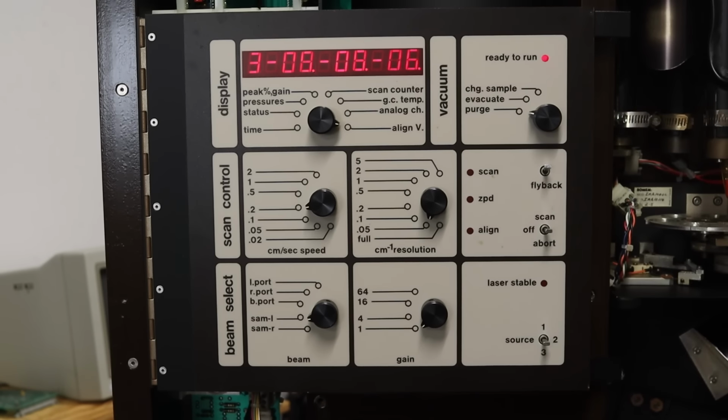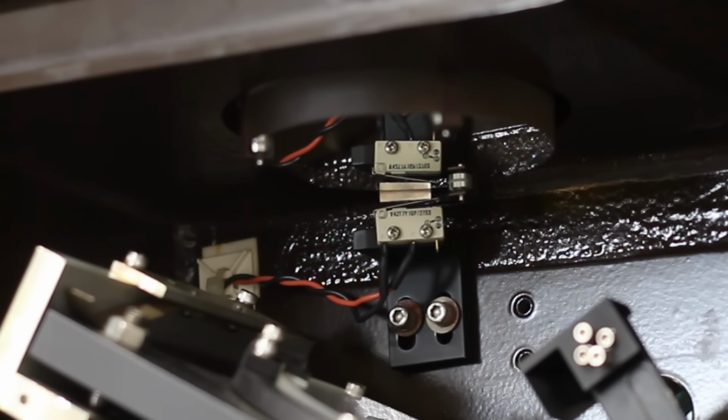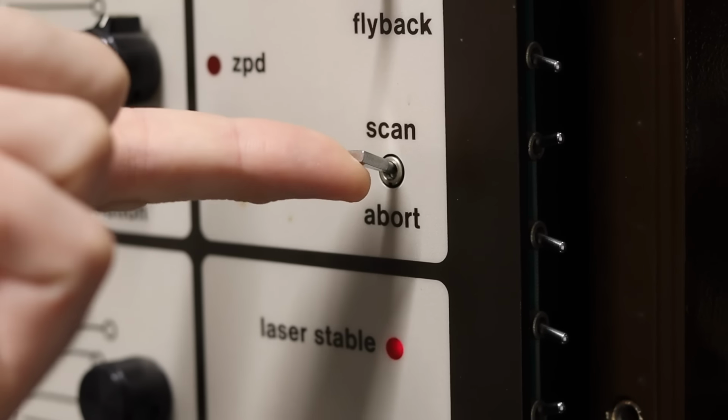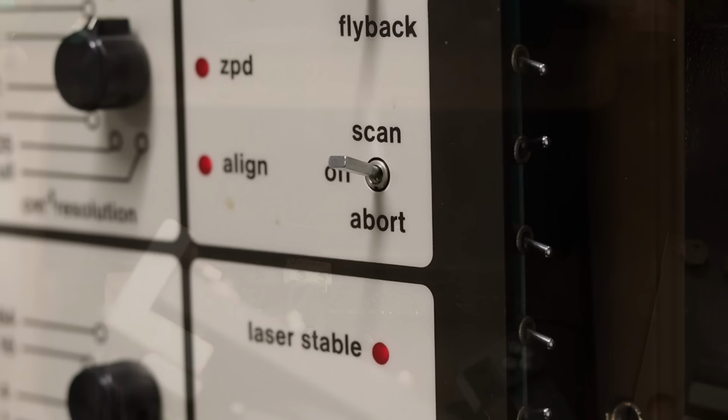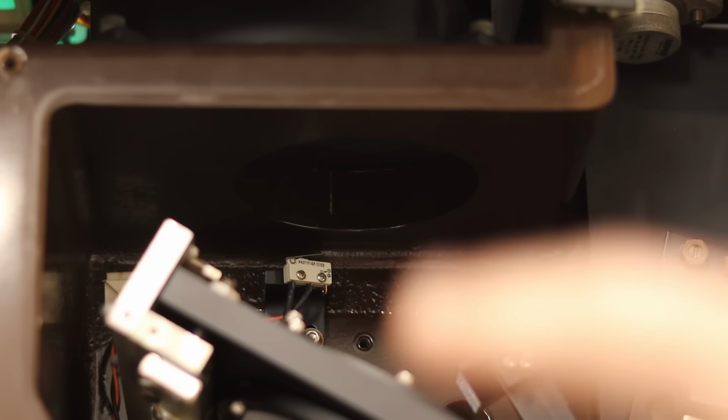Now that we're in mode 3, the mirror should be moving. It is moving. That is great news. It is moving incredibly slow. All right, check this out. I switched it to scan on the front, and the motor sounds way nicer. And you can see our mirror is just gone.